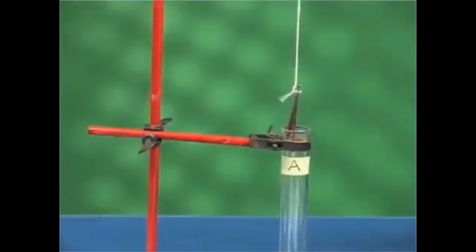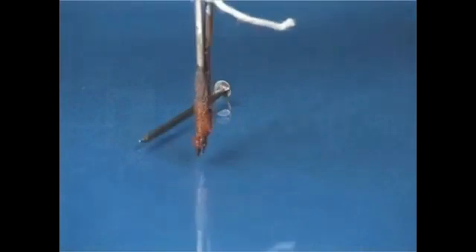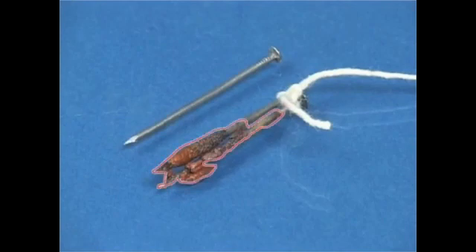After 20 minutes, take out the nails and keep them beside the unused nail. Do you observe any change? On comparing both the nails, you will find that iron nails which are kept in copper sulphate solution have developed a reddish brown layer on them.